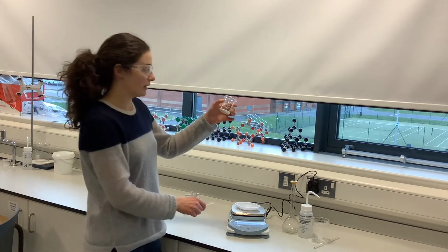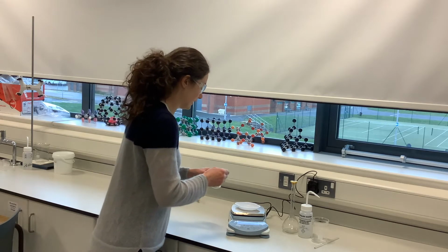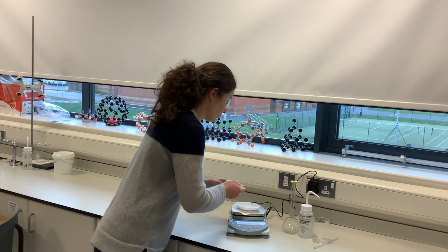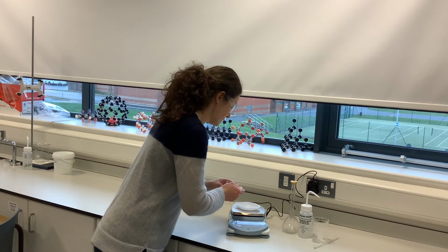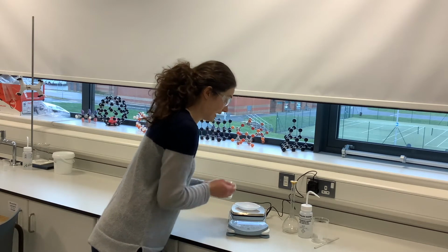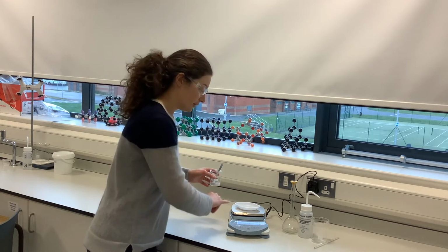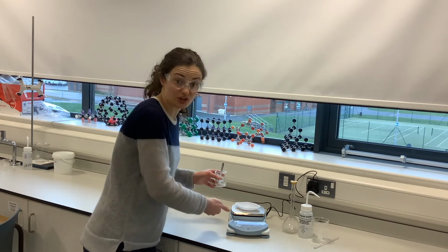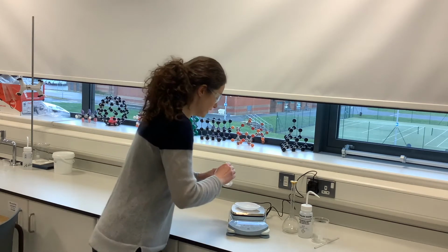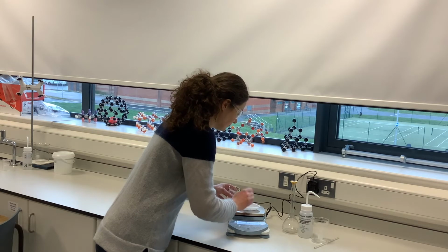So I've got the sample here in a small beaker, and I'm just going to use a spatula to measure that out accurately. So that's just 0.34 grams, so I know I need a good bit more. You want to make sure you don't get any on the metal part, the top pan of the mass balance, because that will take into account that mass, but it won't be in the sample that I've measured out, so I need to make sure I do that accurately. So still a bit to go.